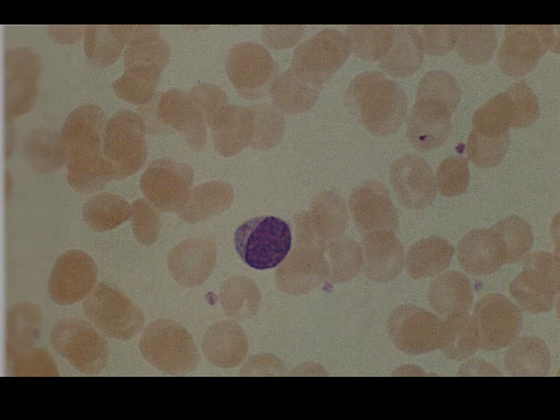Lymphocytes themselves are relatively small comparatively in terms of white blood cells. They're going to have a similar appearance to red blood cells in terms of their roundness and their largeness. They're going to be close in size to them, a little bit larger than they are. But the big hallmark here is that the nucleus basically takes up the whole cell. So when we're looking at these here, that large dark nucleus inside almost occludes all of the cytoplasm. So there's basically nothing left there to see.